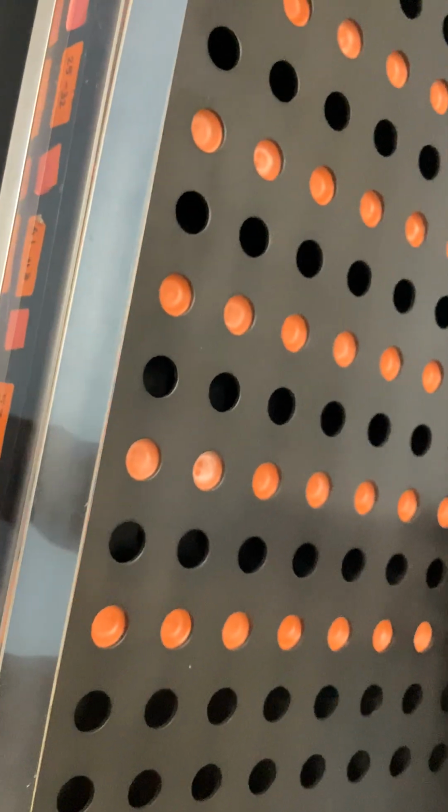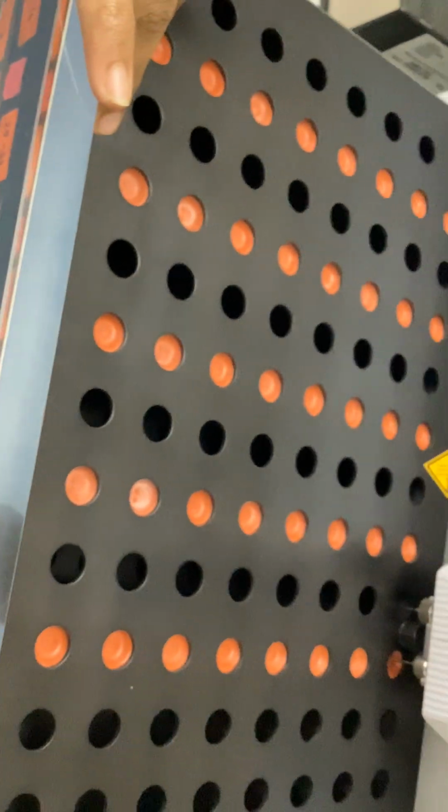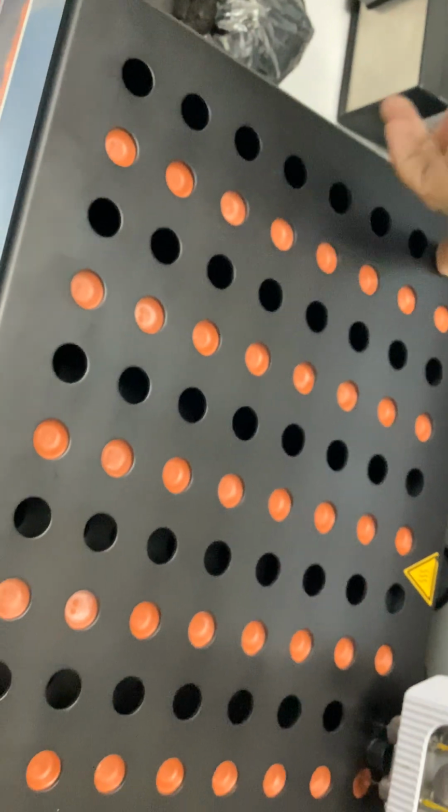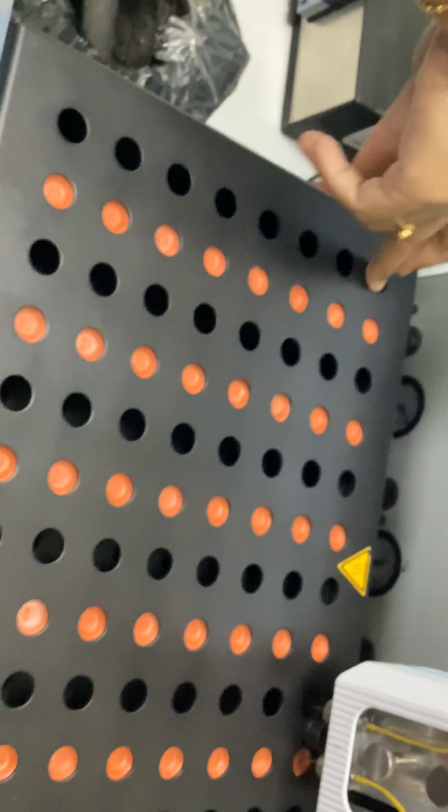And for this particular reaction we need about 3 hours. That 3 hours will get completed by flushing the 2 rows, and then the analysis starts, and the 3-hour equilibration will be over. The first sample is taken, then it goes to the second sample, and there also it would have finished 3 hours by then. That way we take care of it.